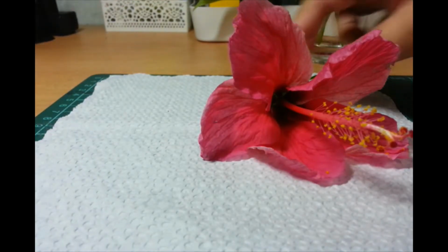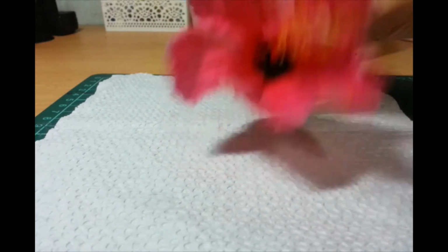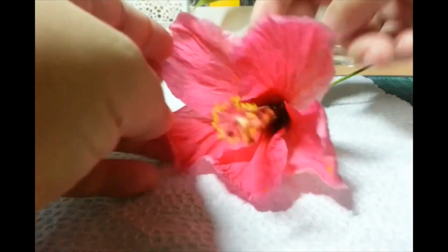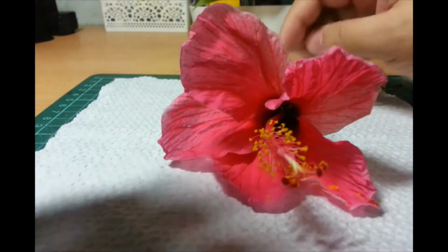Okay, so let's start. If you notice, flowers usually have, well, this flower in particular is radially symmetric. Everything is arranged in a ring. There are different types of flowers, and maybe I can show you some later on, perhaps just pictures.